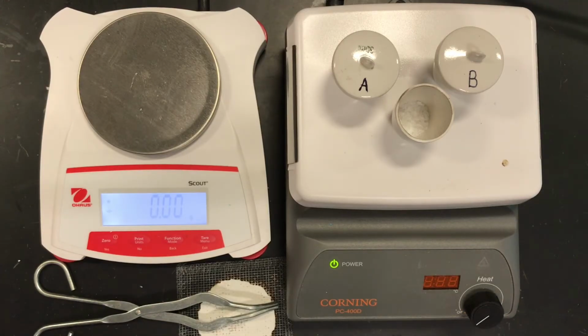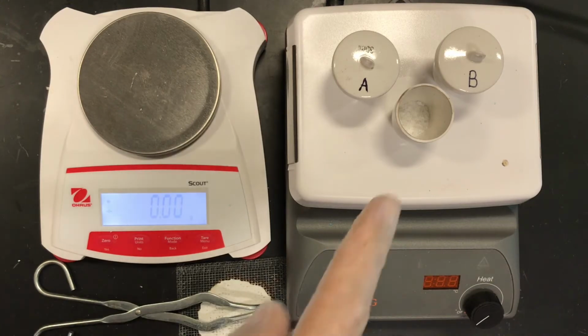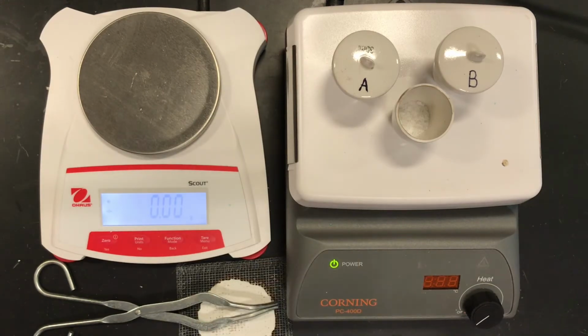So we're going to use a missing mass lab like we've done before, and I have a copper sulfate pentahydrate lab that we used, and we noticed the salt in that lab was a blue color. Here we're dealing with a white or colorless hydrate that we're going to drive off the water with heat. So the purpose of the lab again is to determine the chemical formula, the empirical formula, but using a percent by mass procedure. And these are part of the earlier experiments that we did to determine chemical formulas.